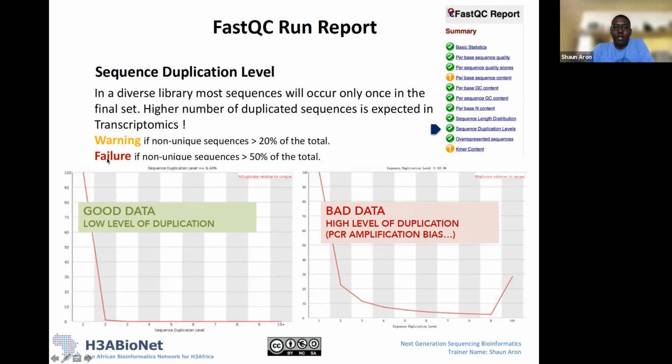Okay, so basically what we see here is percentage of duplication, okay? And what we want to see is essentially a graph that looks like this with very low, this is sequence duplication level, so 1 to 10 in this case. And what we see here is that basically we have very low levels of any duplicate sequences, okay? So we have one copy or one fragment in most of our data sets that's unique. We don't have any where there's 2, 3, 4, 5, 6, 10 copies of a particular fragment, okay?